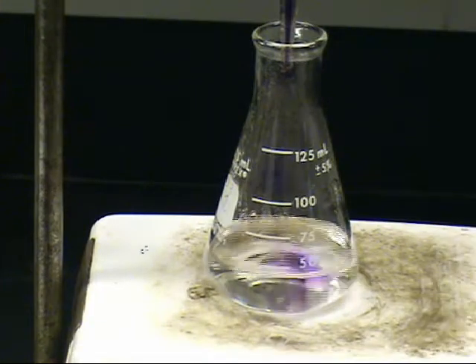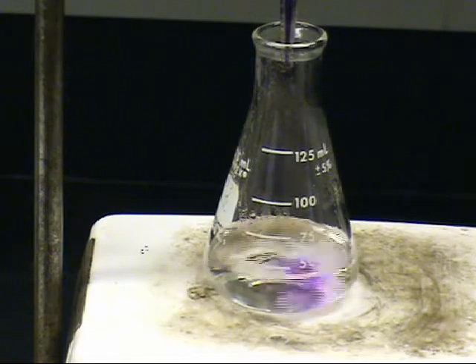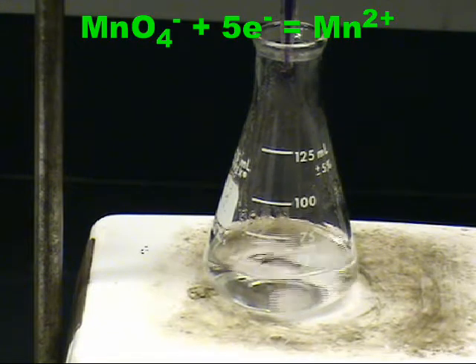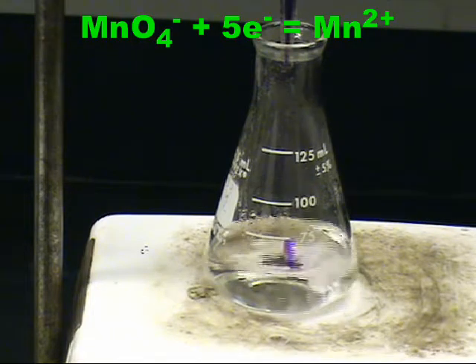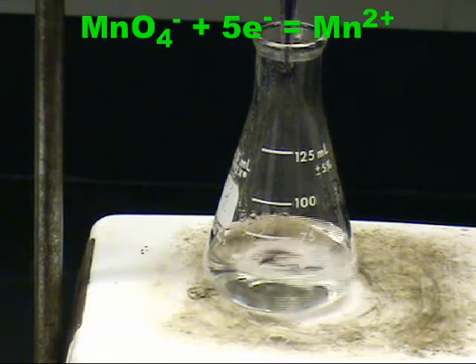This titration employs an oxidation-reduction reaction rather than an acid-base reaction. As the permanganate is added, it is reduced by the oxalate ion to the manganese plus 2 ion, which is nearly colorless. This involves a change in oxidation state from plus 7 to plus 2, which requires 5 electrons.